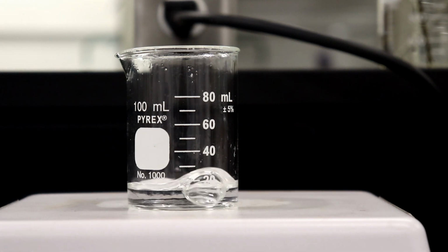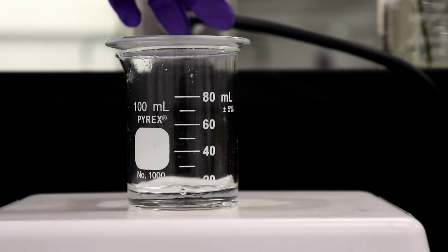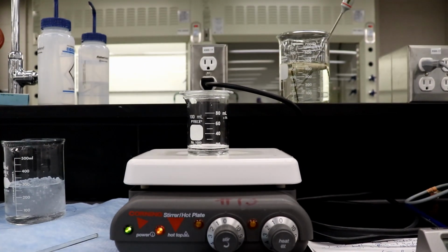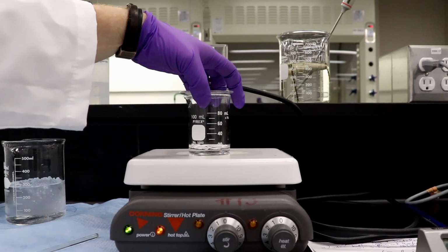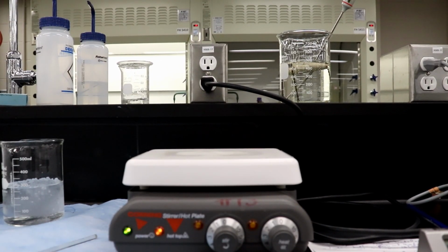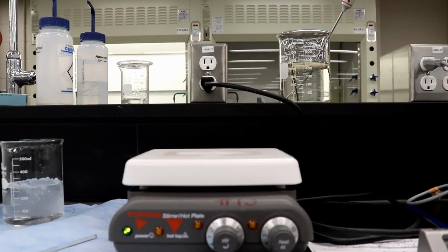That's boiling. So now at the moment that it starts boiling and the beaker looks clean, we're going to kill the heat. We're going to put a watch glass on top of this guy, and we're going to move the whole thing back here to the black to cool. You're going to do this with some kind of thermal glove because it's quite hot. And actually now we can set up a time lapse with the crystals.